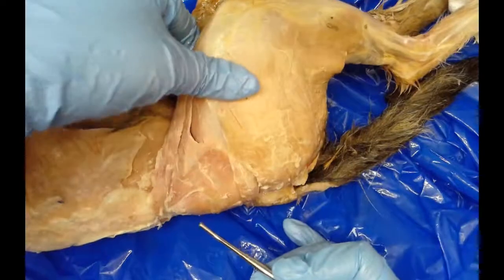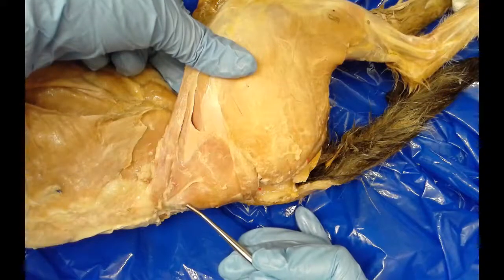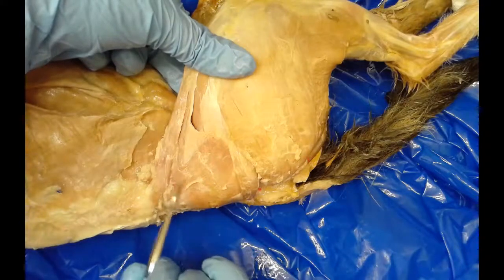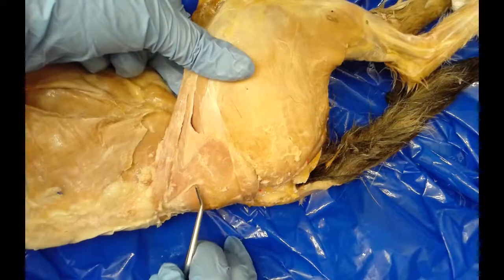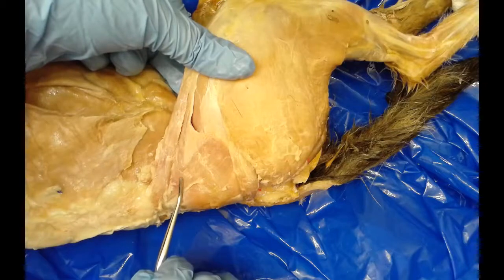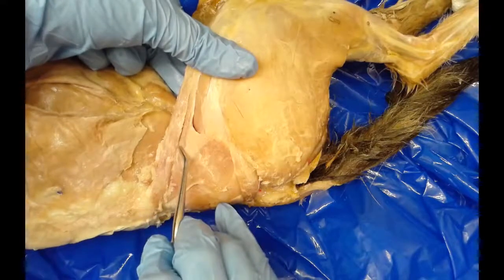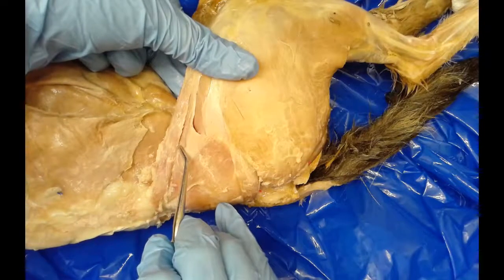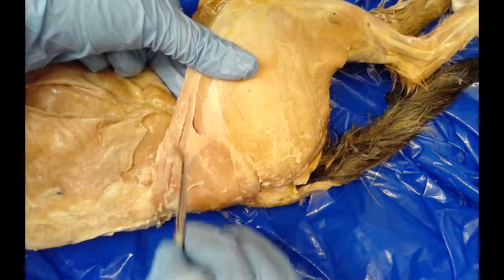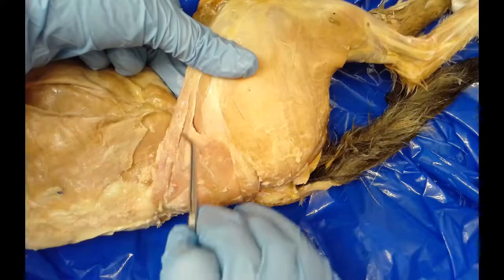In this area we have the gluteus medius — which is not on your list of structures to know — but just more medially is the gluteus maximus muscle, which many of you have heard of as part of our rear end. Just above another muscle called the caudofemoralis — this long skinny muscle right here — which functions to abduct the thigh. It's a little tricky to find because it requires moving a lot of thick fascia or connective tissue to expose it.